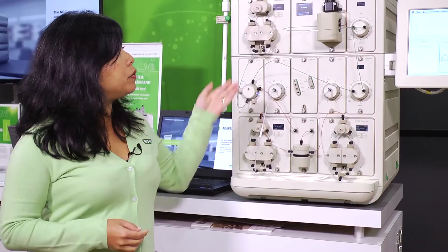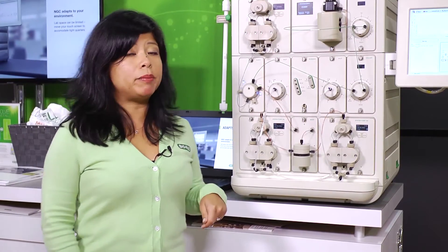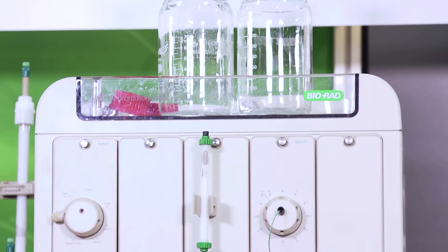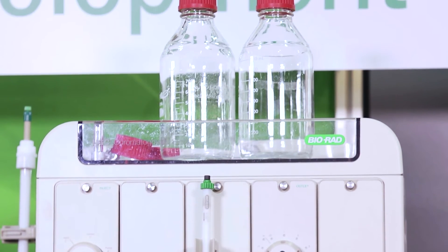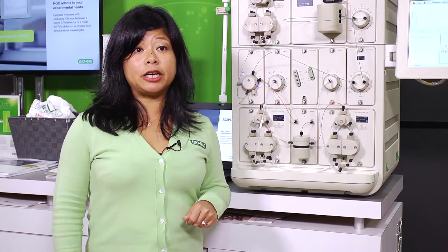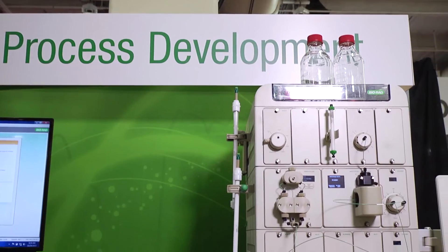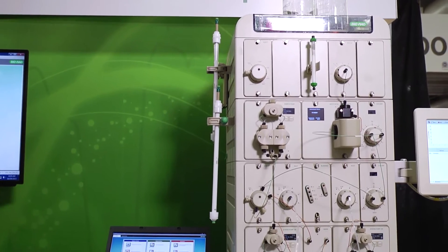Along with the Discover systems, we have multi-wavelength detectors along with a conductivity detector that allows you to monitor four different wavelengths at one time. You can also choose a single wavelength detector that toggles between 280 and 255 nanometers.